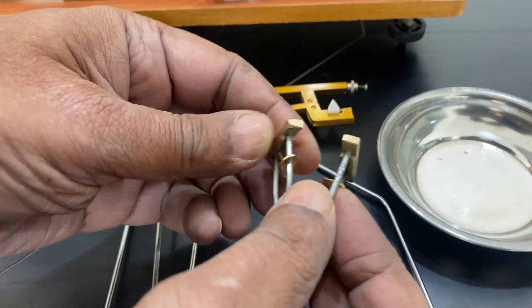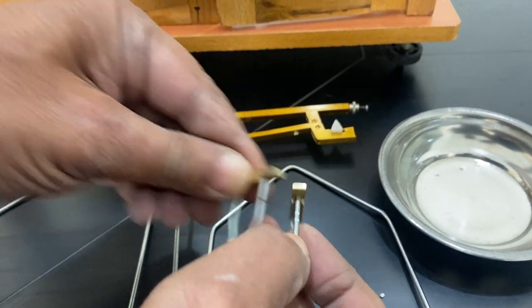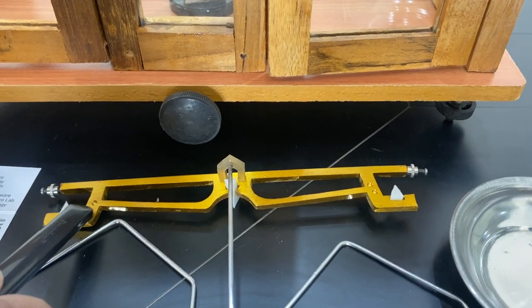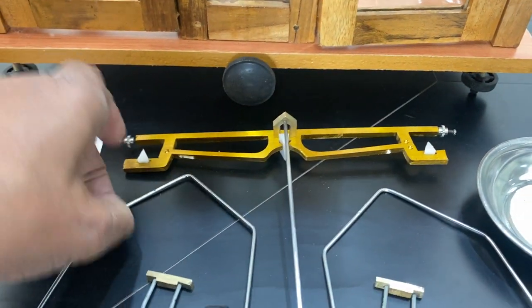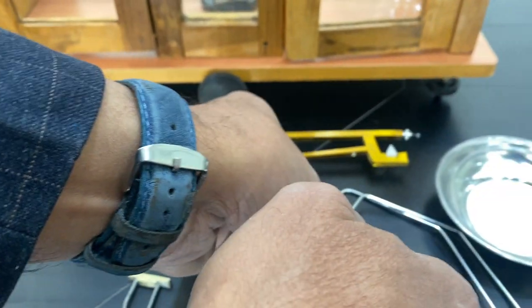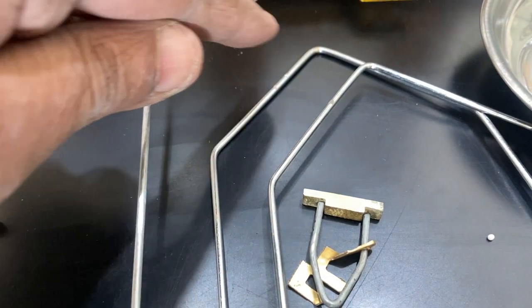This has only one line, and this has two lines. There are two spots here, one spot there, and on the beam there is one marking labeled one and another labeled two. Two markings and one marking - the one marking goes with the one-line piece and one spot for one side.